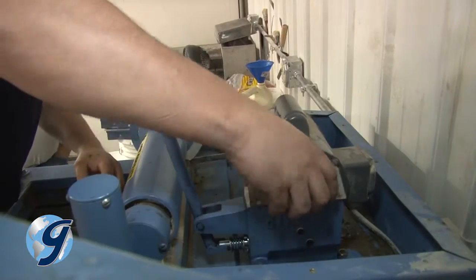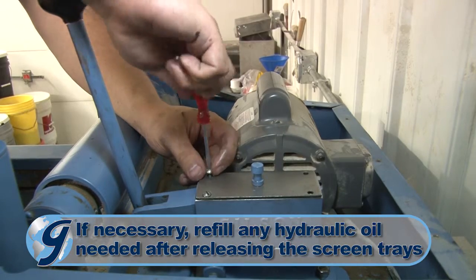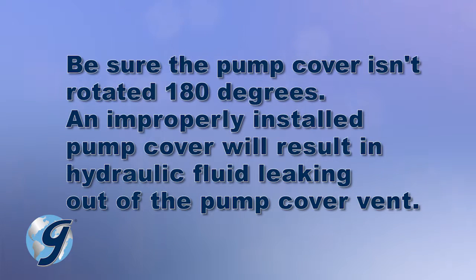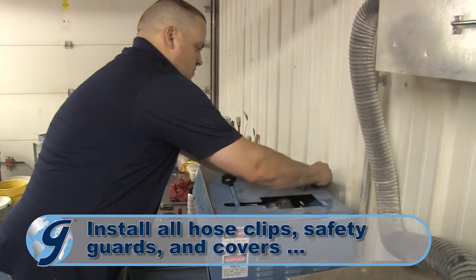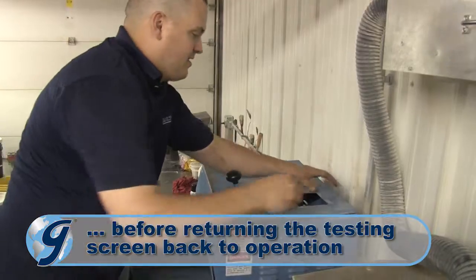Next, install the pump cover on the pump based on the alignment marks made earlier, and release the trays. Be sure that the pump cover isn't rotated 180 degrees. An improperly installed pump cover will result in hydraulic fluid leaking out of the pump cover vent. Finally, install all hose clips, safety guards, and covers before returning the testing screen to operation.